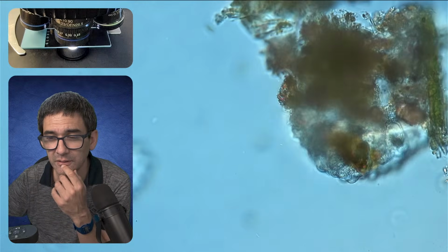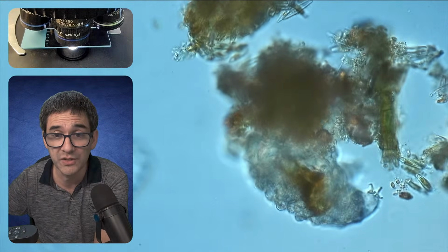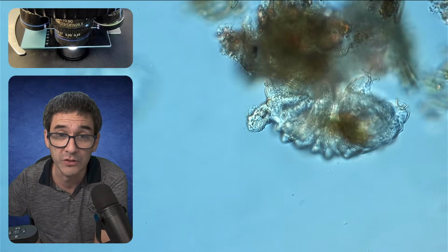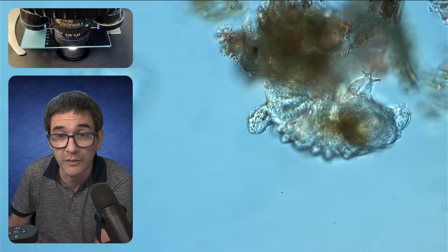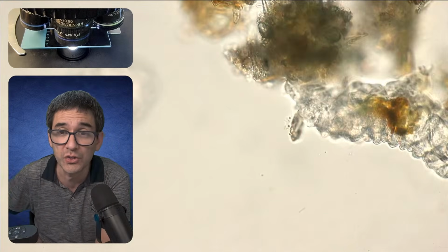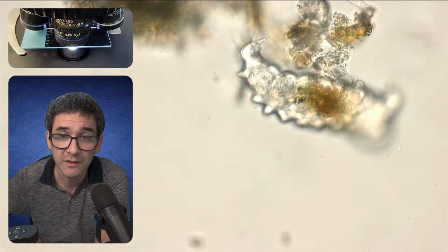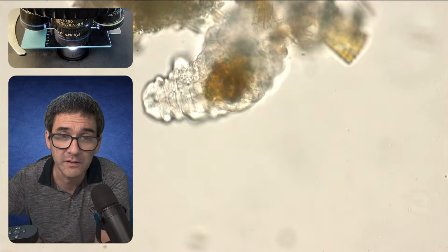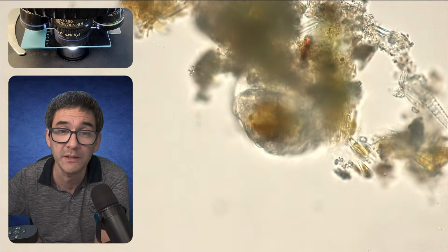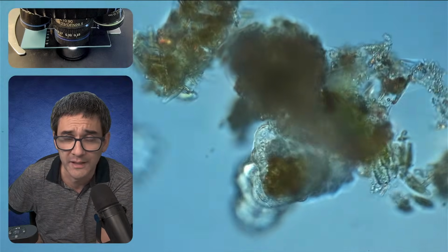No, there are pigmented tardigrades, sure. And if you see, for example, a very basic one over here, if you look into the body, you're going to see that it's mostly transparent, but the inside of this tardigrade seems to be slightly darker, and usually the digestive system takes on the color of the food that it eats. So if it eats a lot of algae, for example, it turns more green. However, some tardigrades actually have a pigmented pattern as well. And that pigment is also used for identification.